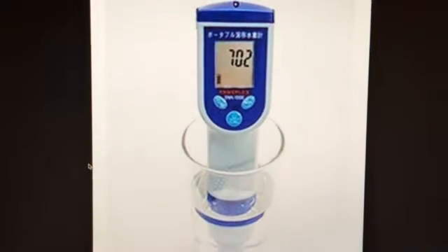First, let's start with this. This is an ORP meter. This is not a hydrogen measuring device. A lot of people think it is, but it's not. This is probably one of the worst ways to measure hydrogen because it doesn't actually measure hydrogen at all. You really can't go off an ORP reading. Just because you get a negative ORP does not automatically mean something is good for you.